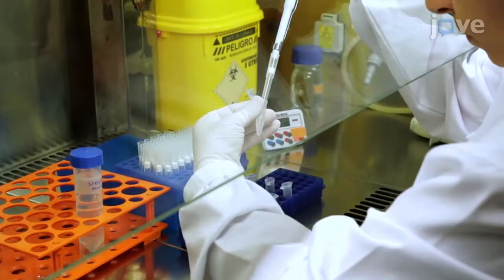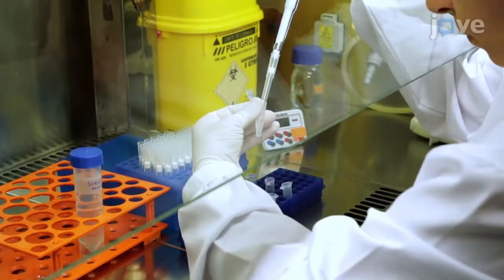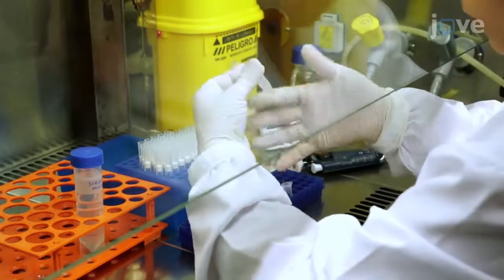After incubation, add the content of the DNA tube to the liposomal tube, gently mix, and incubate at room temperature for 15 minutes.